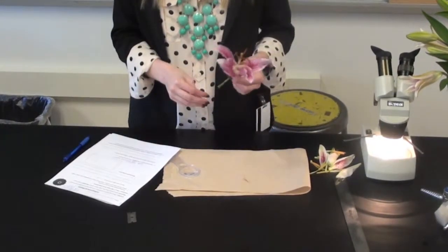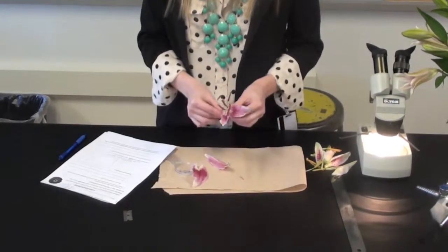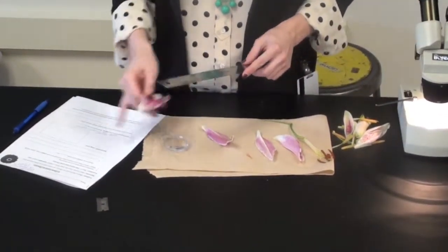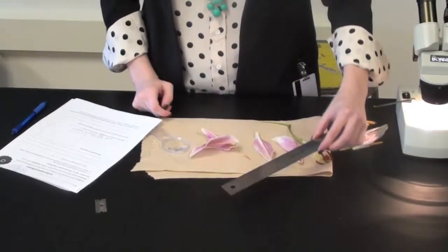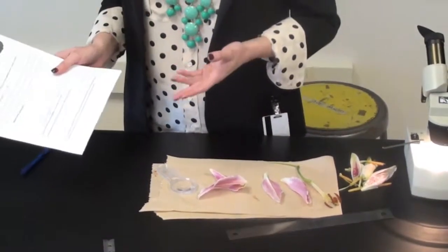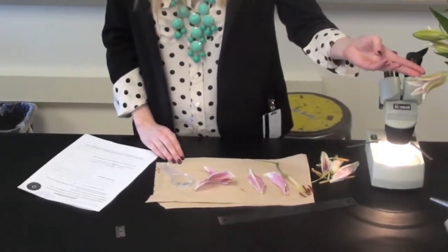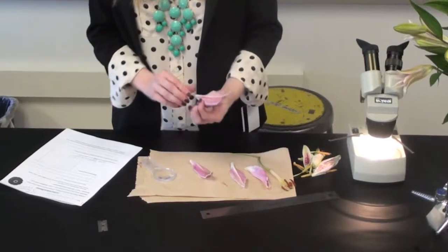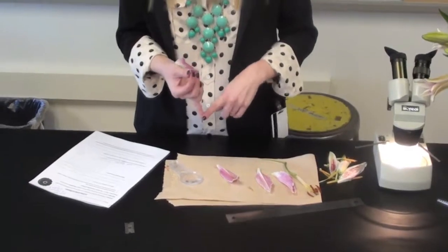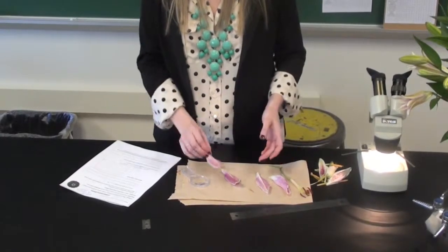You will then have to measure the petals on the flower, so you will just simply remove all of the petals. And then take your ruler and measure it in centimeters, and then you write it on the line. The next step it talks about is make observations about the sepals. And if you remember, the sepals are just there to protect the flower as it begins to grow and open up. So on the lily, our example today, the sepals and the petals actually work together. They're the same object. And also we might have tulips the day of the lesson and daffodils, and it's the same way. The sepals and the petals are the same unit.